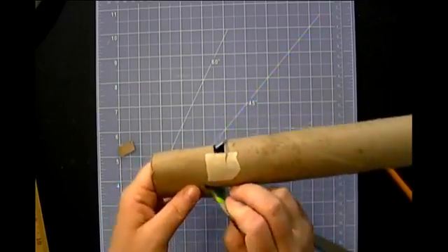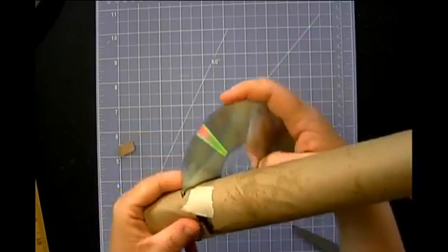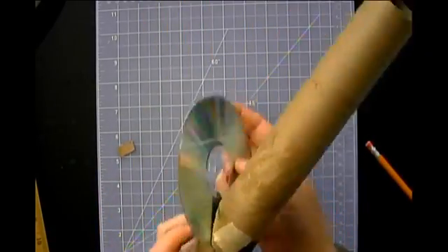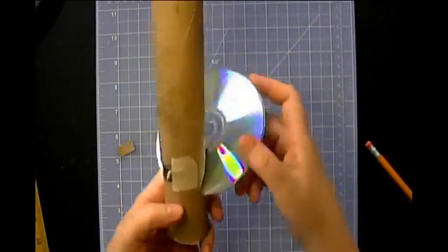Ooh. And for some reason, there we go. Okay, so now I've got that fitted in there pretty well. I see what happened. When I cut the second time, I created a little notch there.